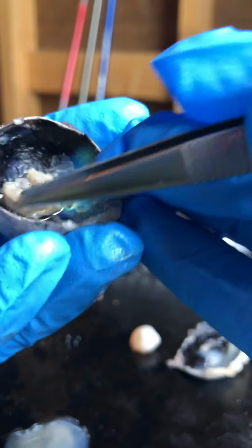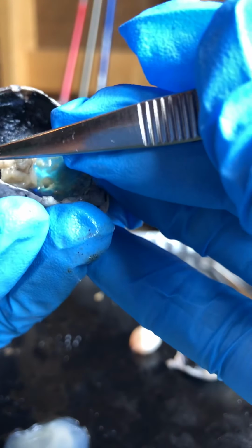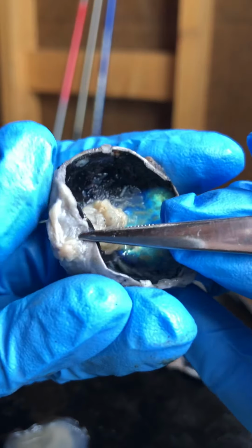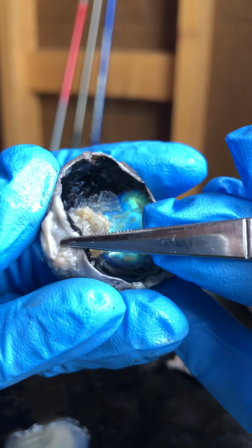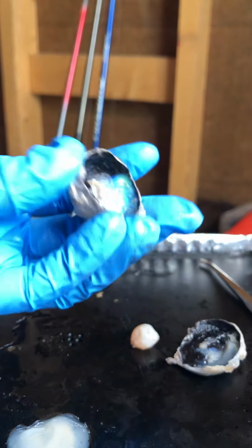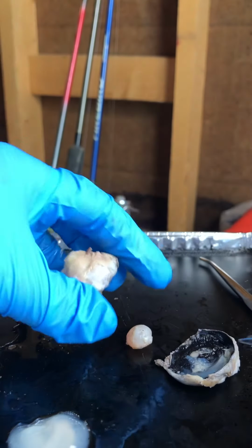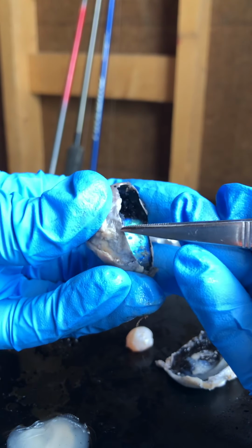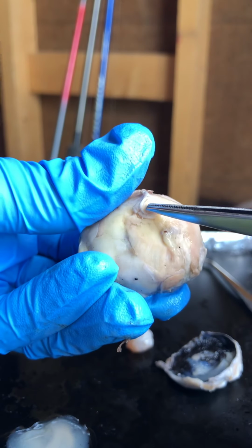And this thick portion underneath the choroid is the sclera, the thick white tough layer. The sclera is a tough white portion of the eye that forms the majority of the eyeball. The reason it forms the majority is that it covers the entire eyeball, like this. Even the anterior portion has sclera. This back is the optic nerve.